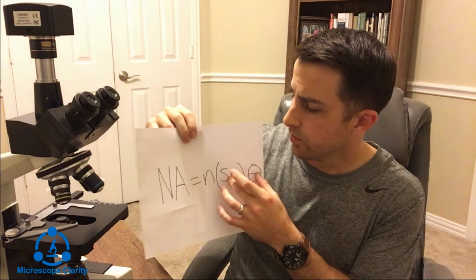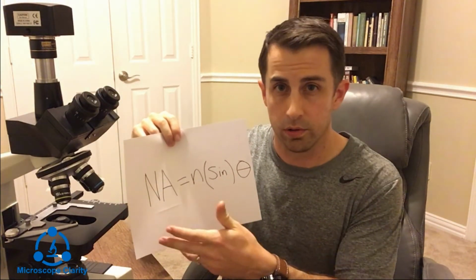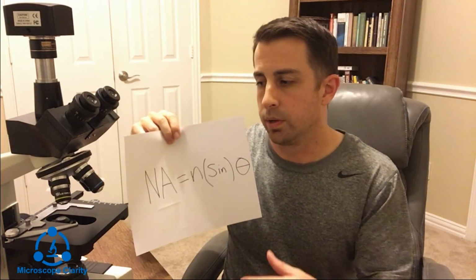So you're taking the sine of theta and multiplying it by the refractive index of the medium in which you're observing the specimen. Typically, if you're not using any immersion oils, the medium is going to be air, and the refractive index of air is 1. So let's take a closer look at the microscope and understand what this concept actually means, because it's a little bit abstract and it's really hard to understand unless you actually look at it with the microscope.